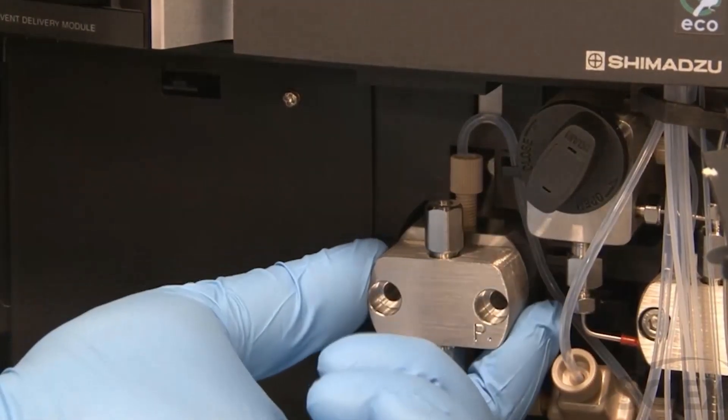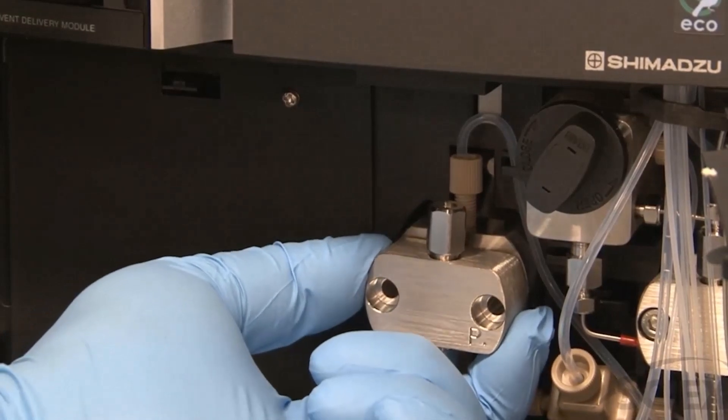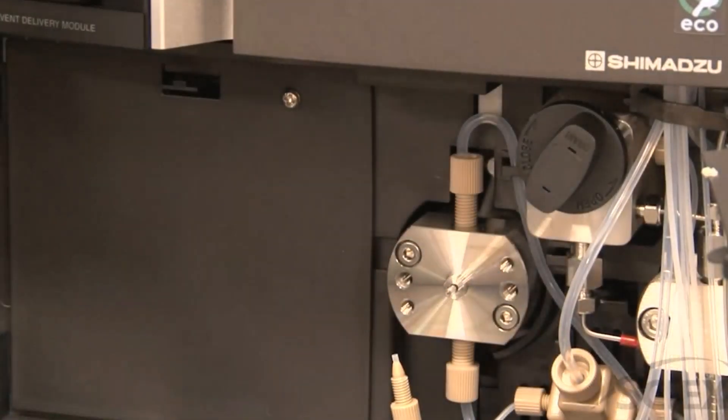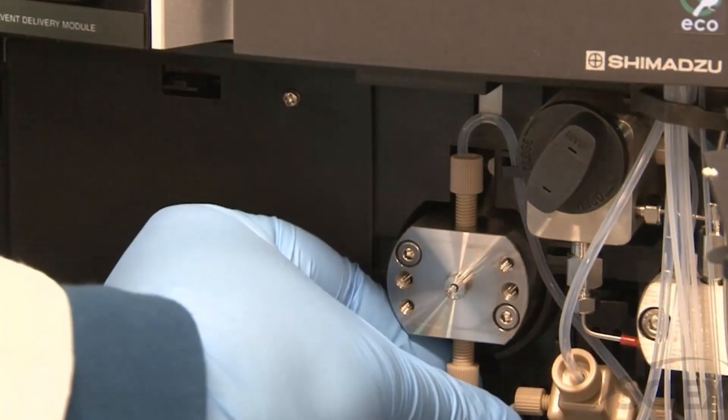Pull the pump head out while keeping it straight. Disconnect the seal rinse lines.